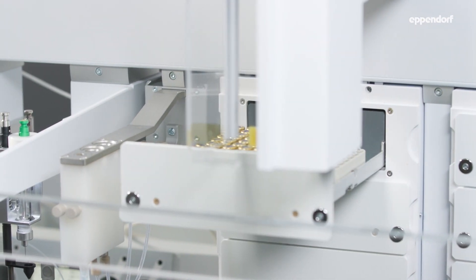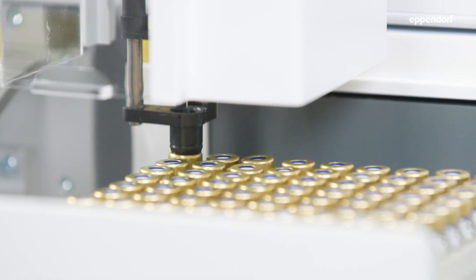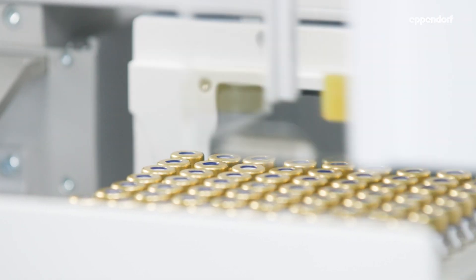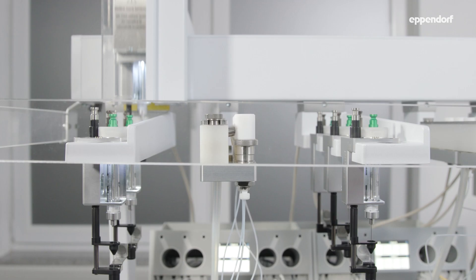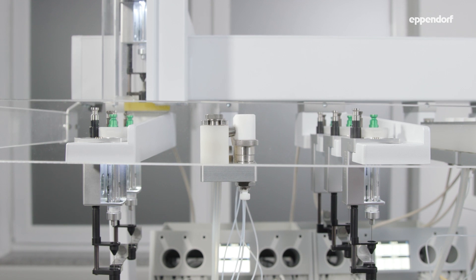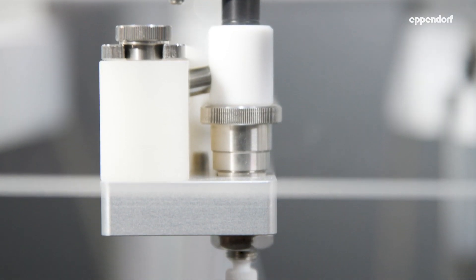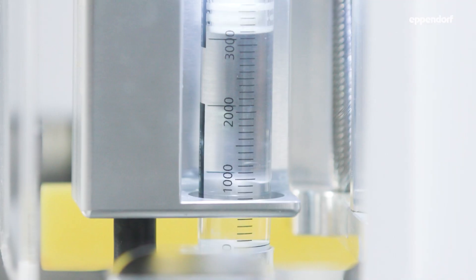So you can schedule your time a lot better, because you can do the preparation of your run over the week, and during the weekend you can just let the system be up and running — you wouldn't lose any data points and collect all your samples.